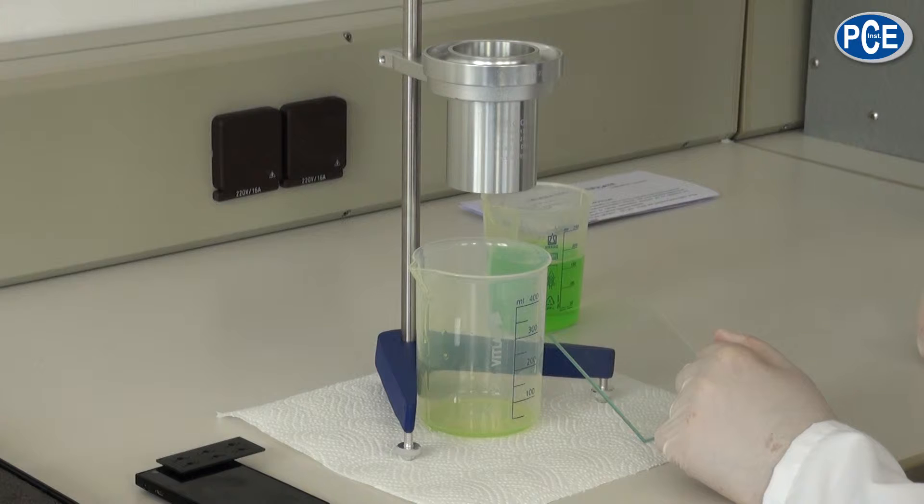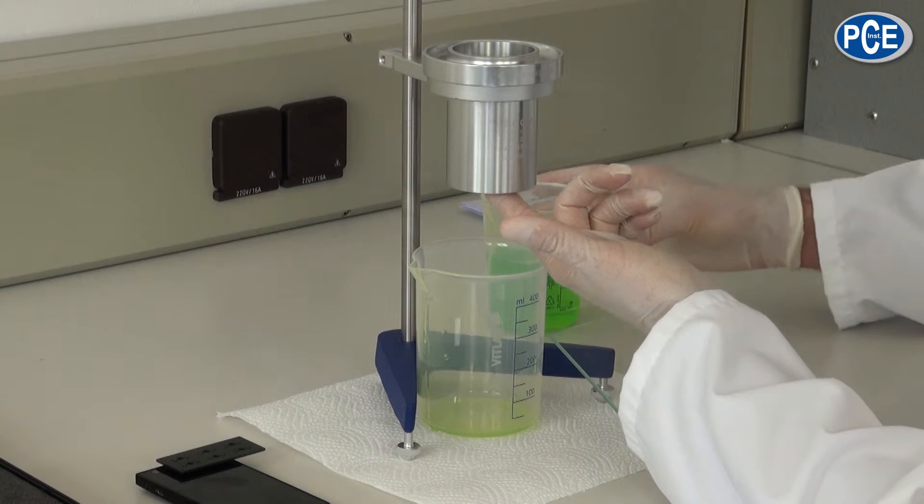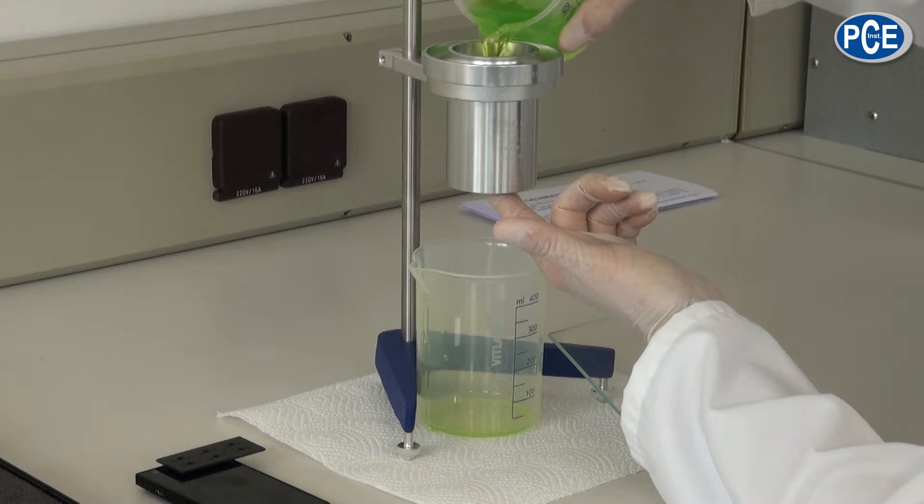First of all the overflow cup is placed into the stand holder, the outlet nozzle is closed with one finger and the fluid to be examined is put bubble free into the cup.